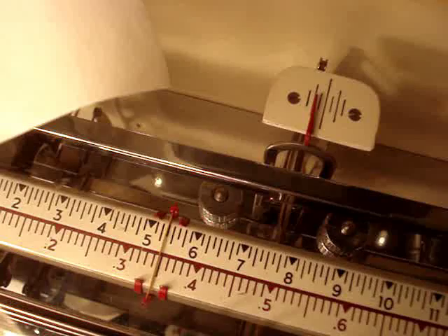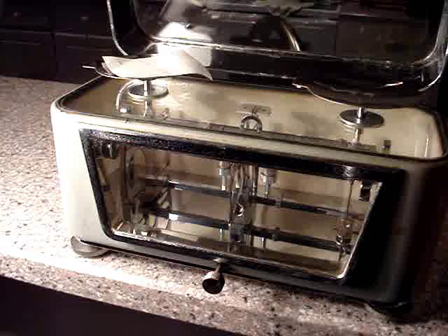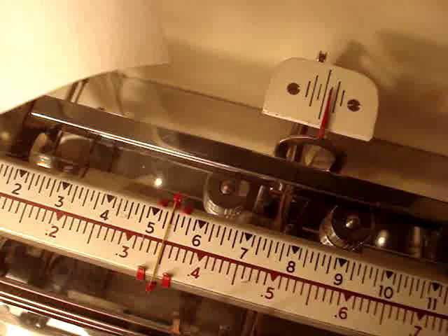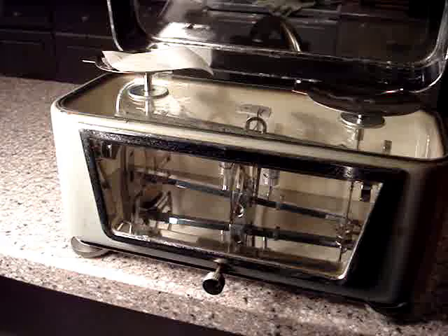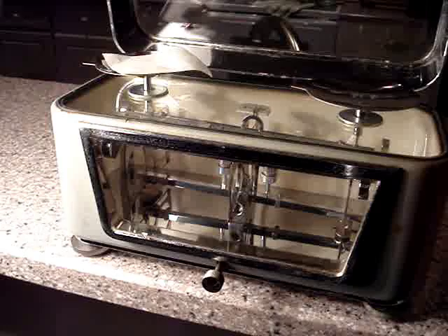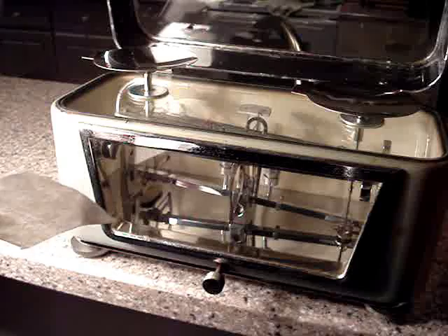Purely mechanical — these are the good ones. Torsion beam balance. I've got the scale set for 0.35 gram, or 35 one-hundredths of one gram. Let me take this piece of paper off the left platform — you can see the beams moving. This piece of paper weighs approximately 35 one-hundredths of one gram.